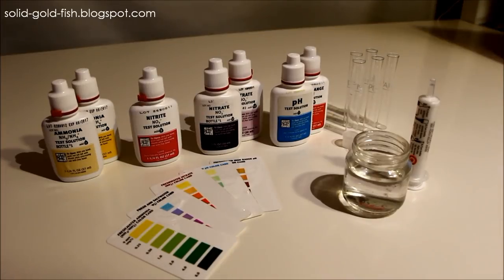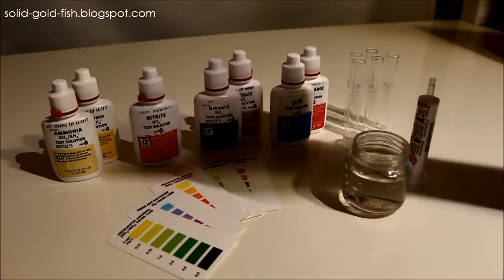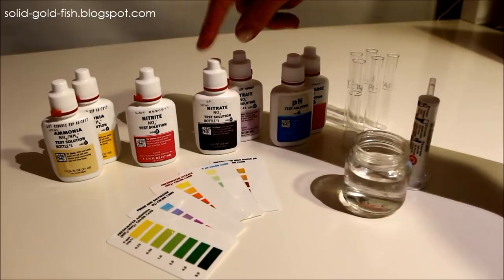Hey everyone, in this video I'm going to show you how to test your aquarium water if you have a freshwater fish tank. I'm using the API master test kit and it comes with an ammonia test, nitrite, nitrate, pH, and then high-range pH test.